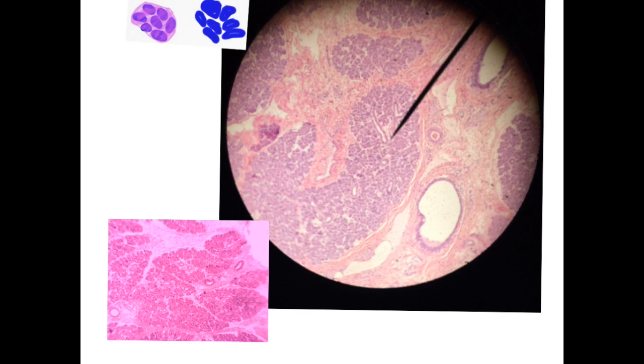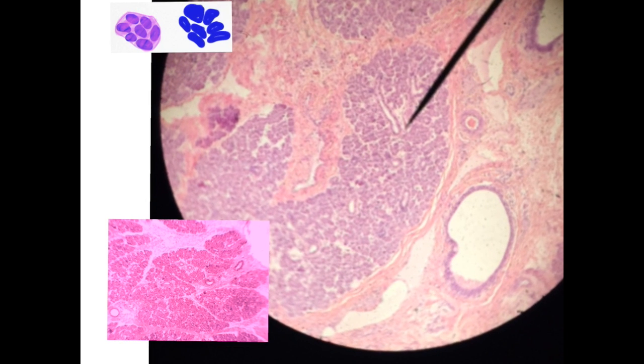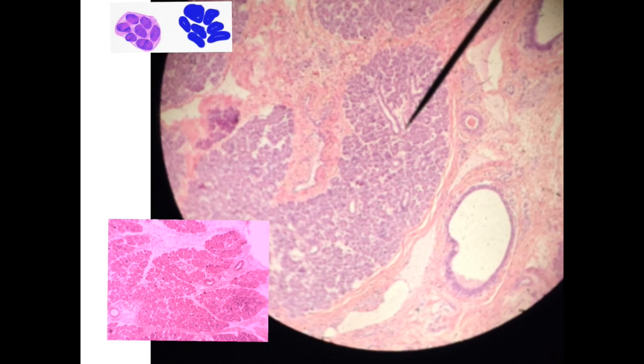The second slide, which is the parotid, and I have mentioned how they differ in the appearance of the connective tissue septa in between, but the most important thing is the presence of the ducts inside the lobule. This is the lobule. Look at the lobule, you will notice that it has ducts. And this picture is from your slides, not from the internet. This is the slide on which you will be examined, and these are the ducts inside the lobules. This and this and this and this and this.